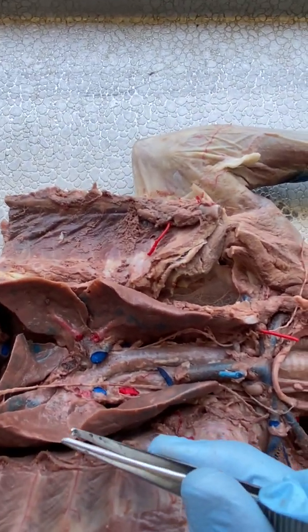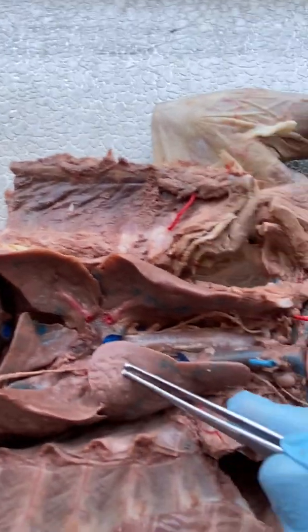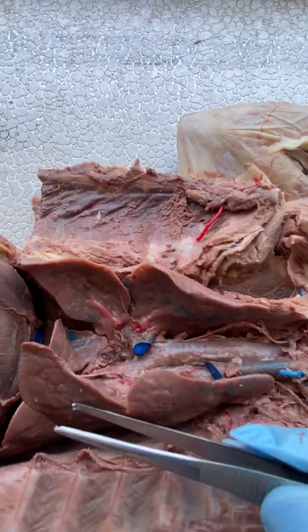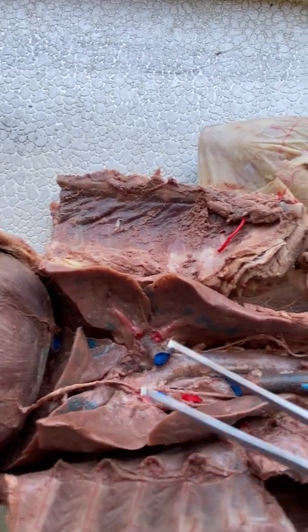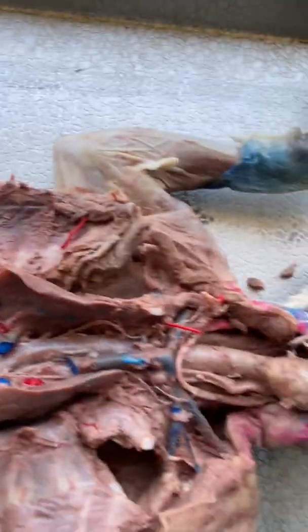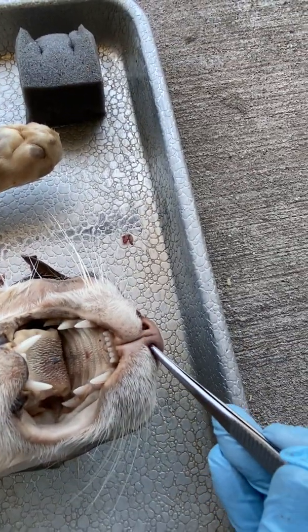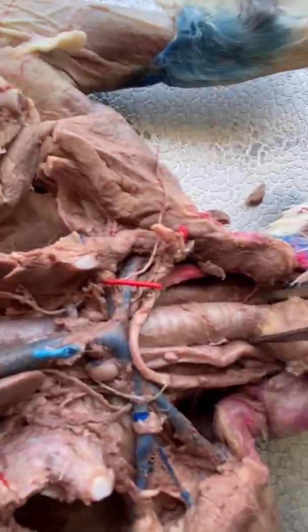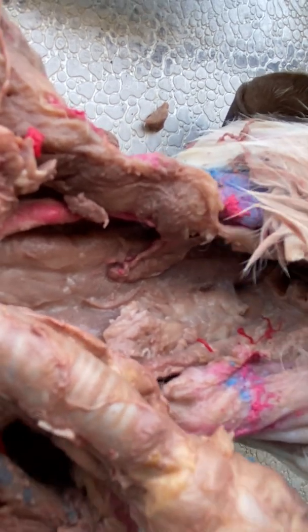The last two things on your list are the visceral pleura and the parietal pleura — we can't see those because they're the membranes making up the outside of the lungs, so you don't have to worry about identifying them on the cat. You should be able to identify the right versus the left lung. So let's review: we've got our external nares or mouth going into our oral cavity or nasal cavity, then air goes into our pharynx.